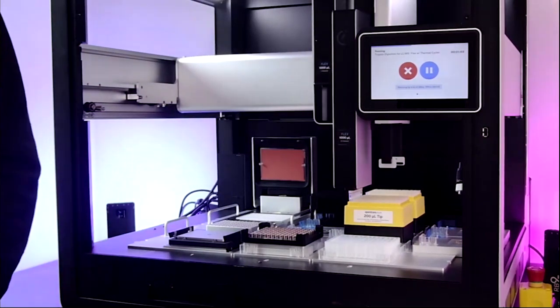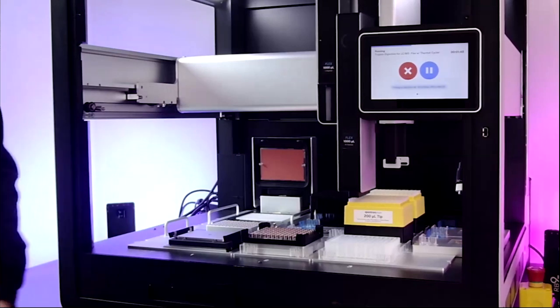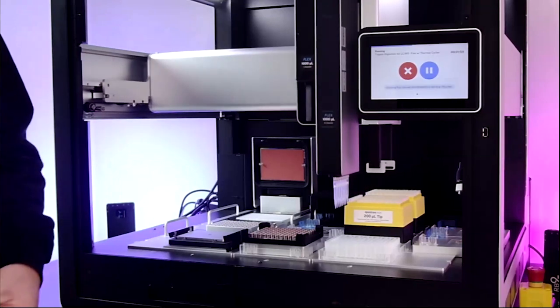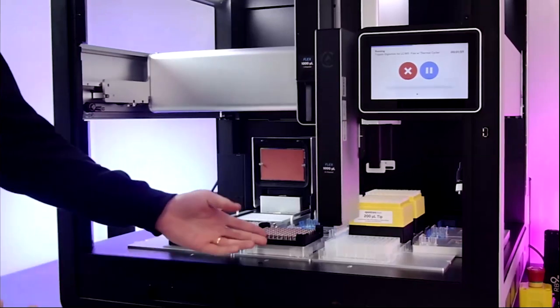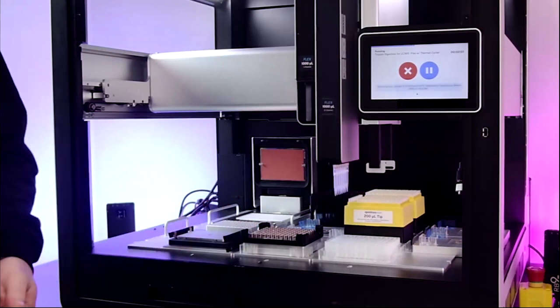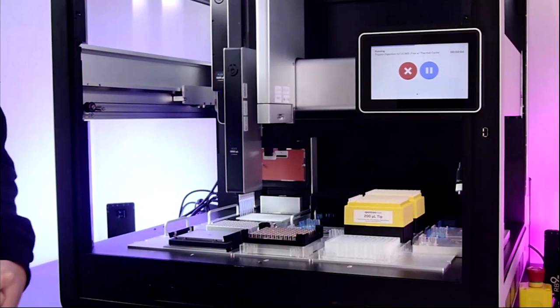Because the plate is already on the thermocycler for this as well, which is a really nifty trick to save time and also save deck space, we will not need to have any kind of gripper interaction. If the plate were to need other steps, such as magnetic bead cleanup, the plate would obviously have to start in a different location, and then the on-deck gripper can really shine.